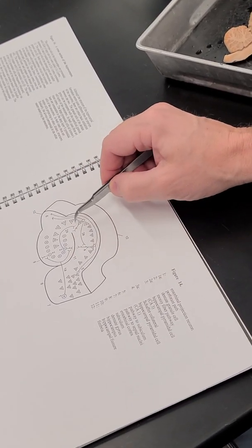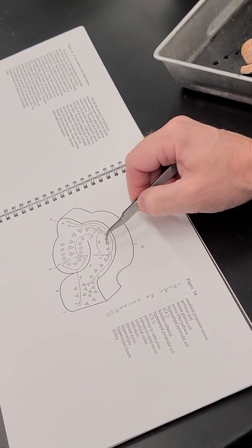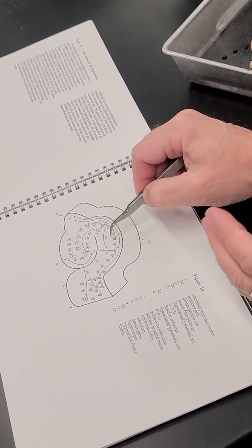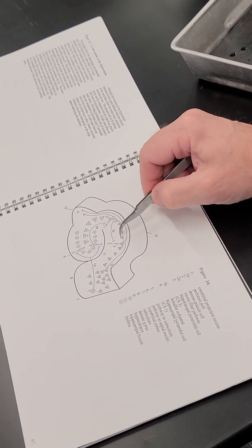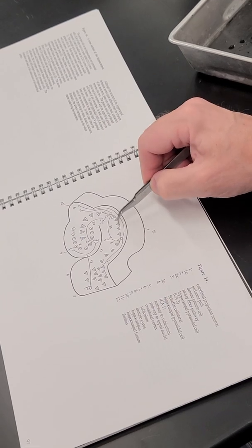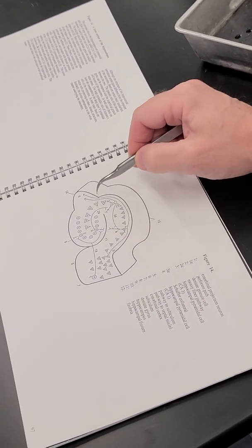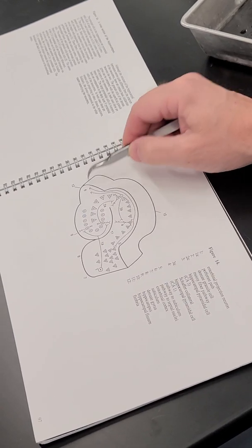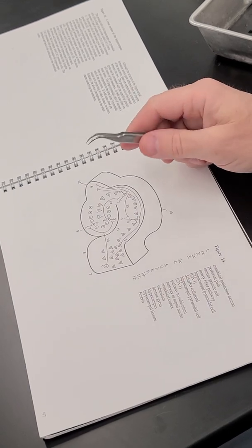And so in one of the deep laminae or layers are pyramidal cells, just like we've talked about with the Betz and non-Betz motor cortex. Those are cells that project out of the hippocampus. Their axons will leave the hippocampus and go into the subiculum or go into the fornix, and that's where the output from the hippocampus goes.